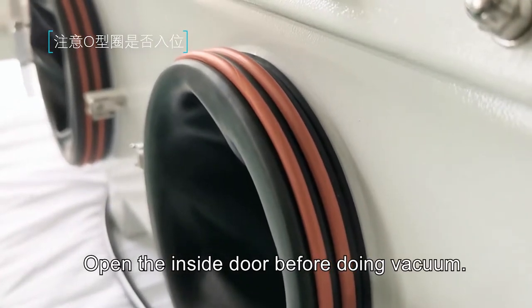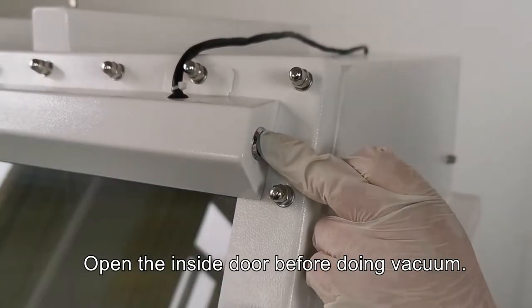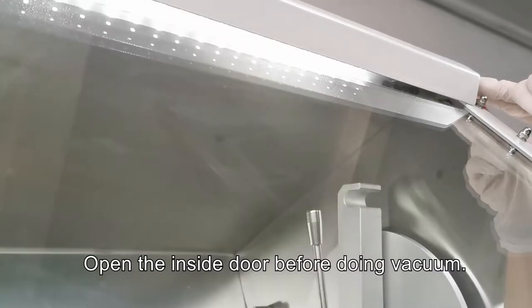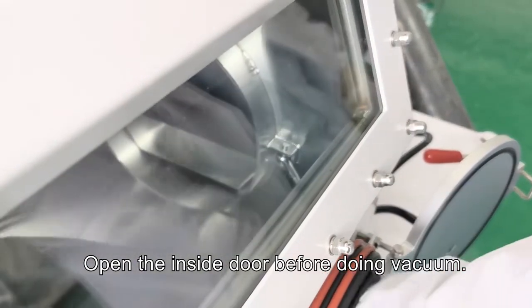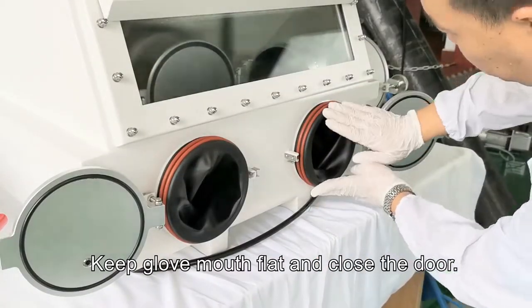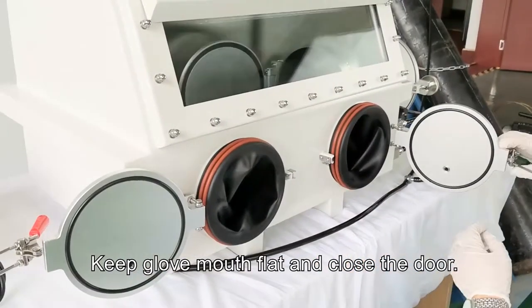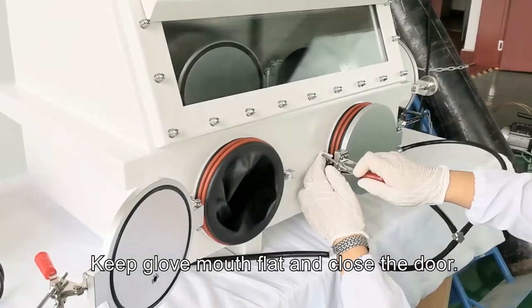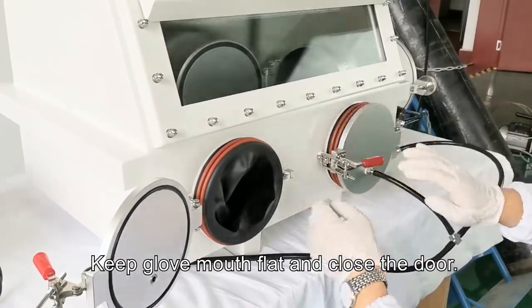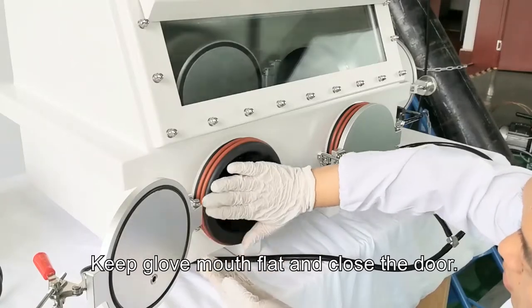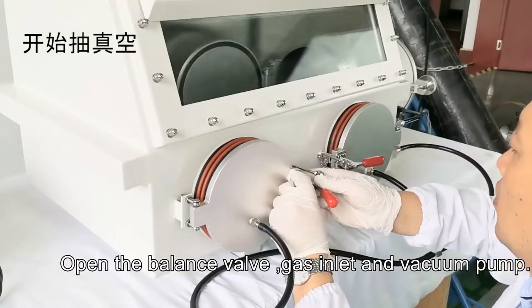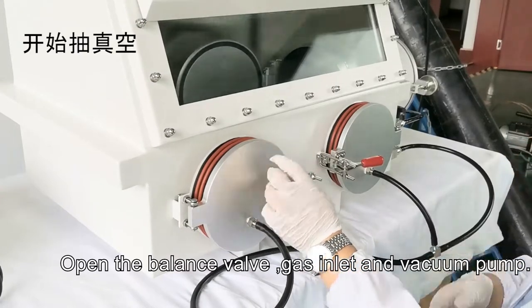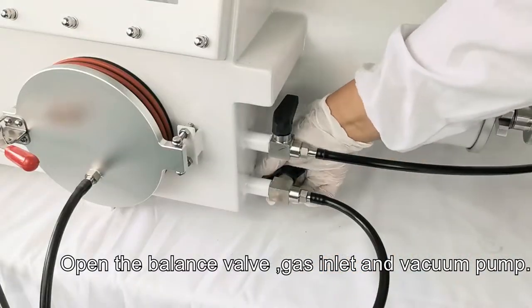Open the inside door before doing vacuum. Keep glove mouth flat and close the door. Open the balance valve, gas inlet and vacuum pump.